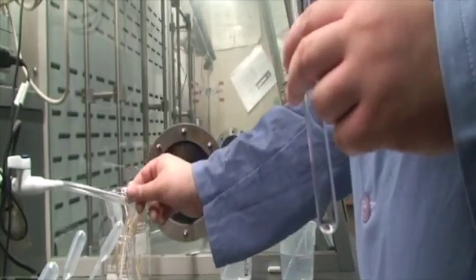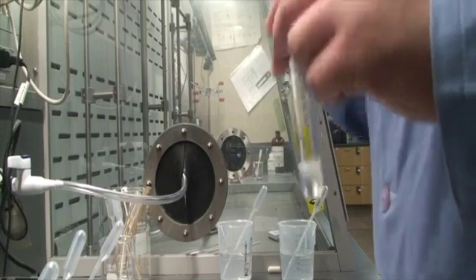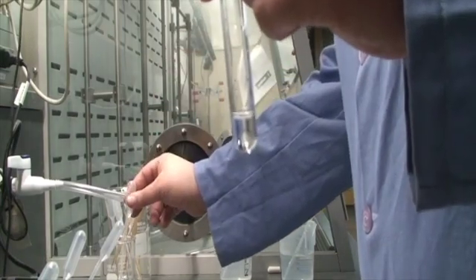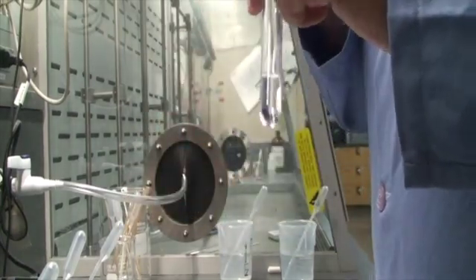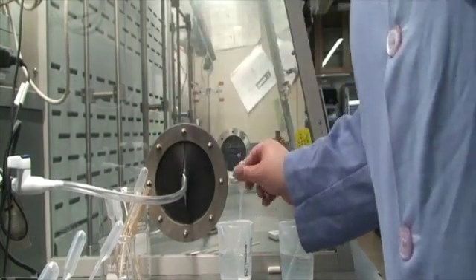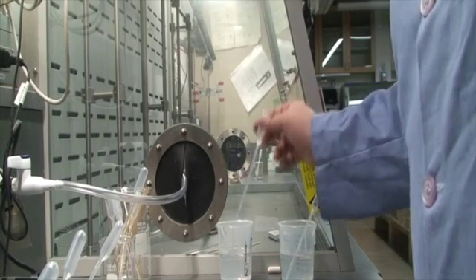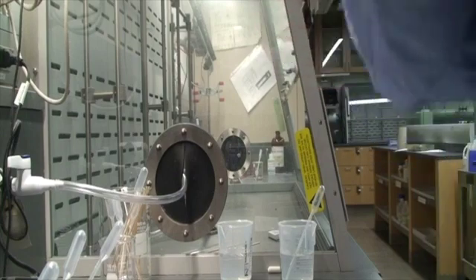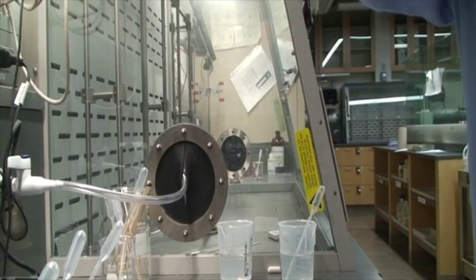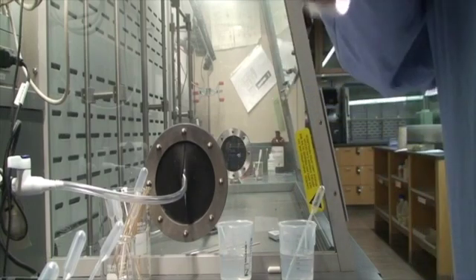So I'm going to take a fresh sample of unknown G. We don't want any weird concentration effects. All right, and now I'm going to add sodium sulfate. You can think about why I would choose to add sodium sulfate. What ion is that going to help me detect? All right, so here we go. 1, 2.